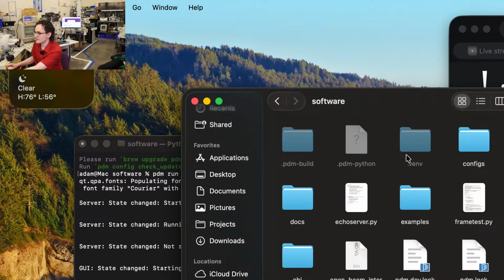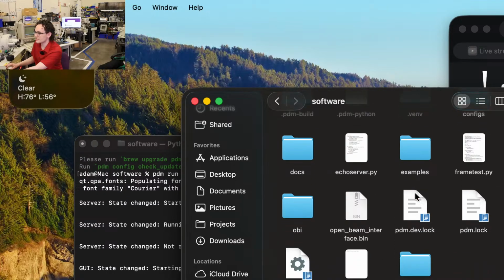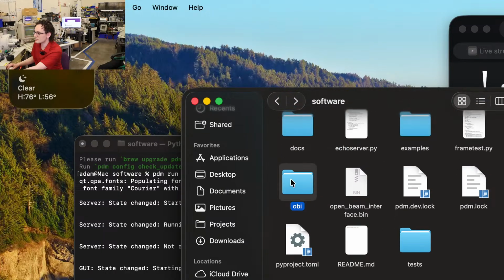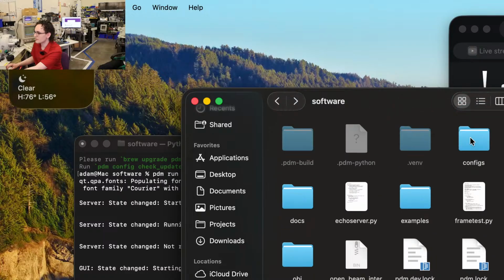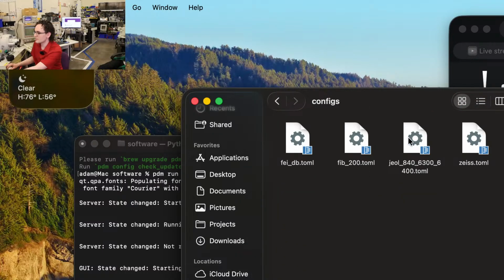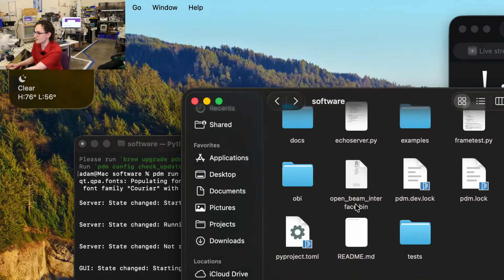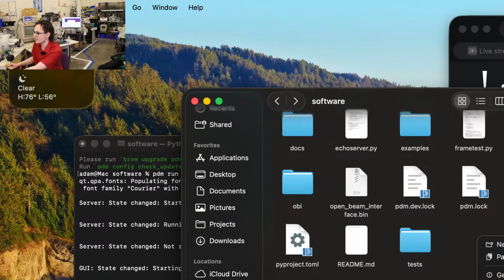So we need our example toml file, which is under, let's see here. There we go. It's under configs. And we're going to be using the JEOL 6400 toml. So we're going to copy that into the top level of our software folder. And we're going to rename that to be microscope.toml.